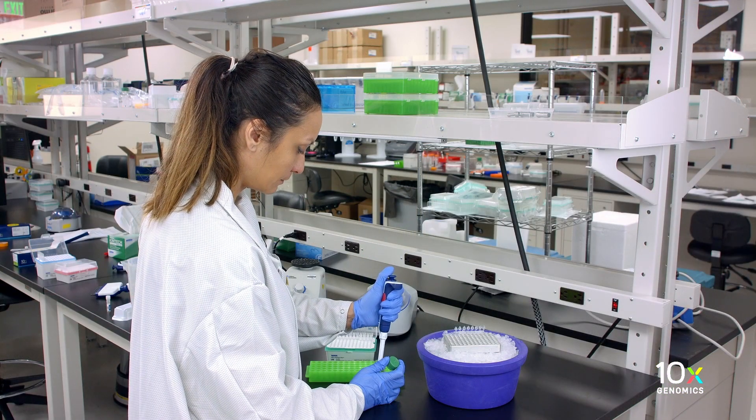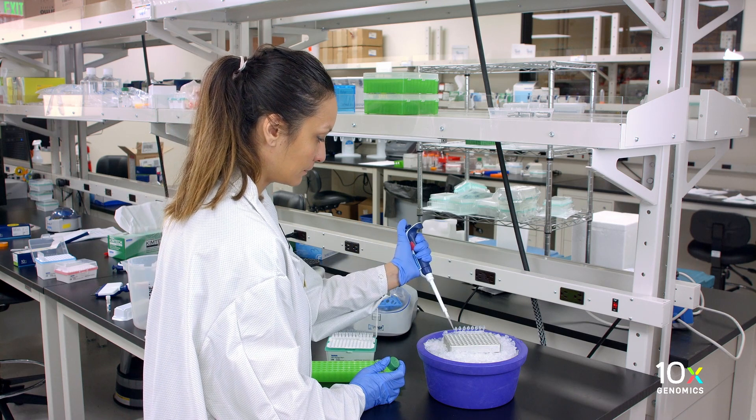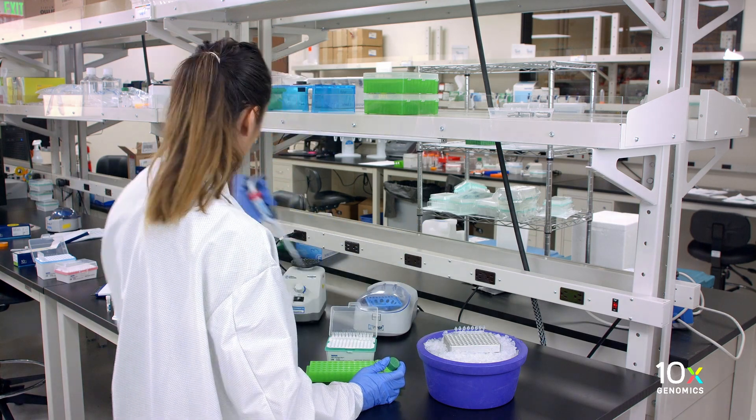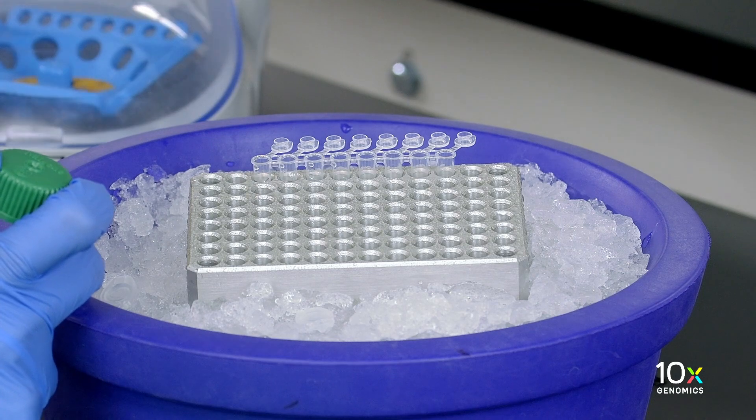Add 35 microliters of water into the aliquoted master mix for all four samples. The master mix should be on a chilled ice block.